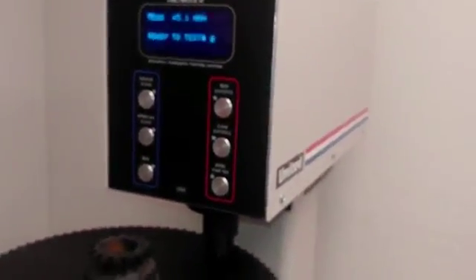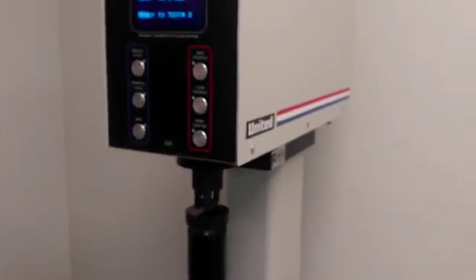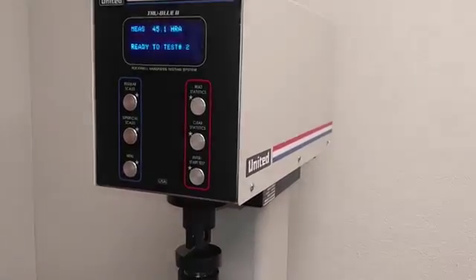You just back it out and pull it off. For parts that are long, you may have to secure the machine to a table so it doesn't fall over on you.